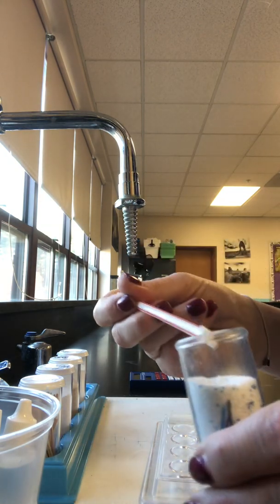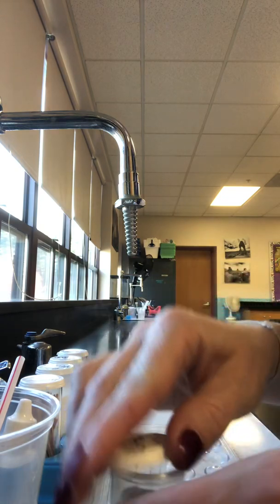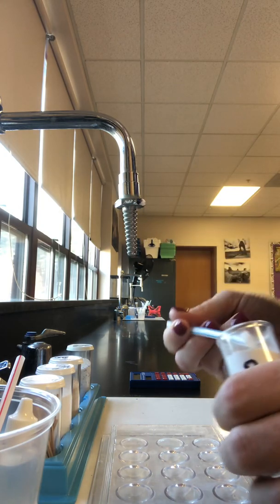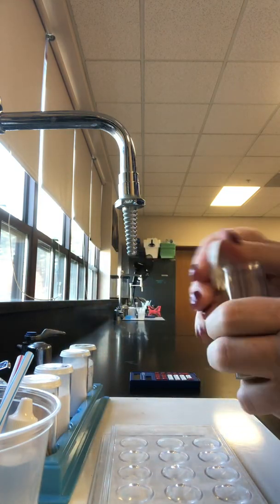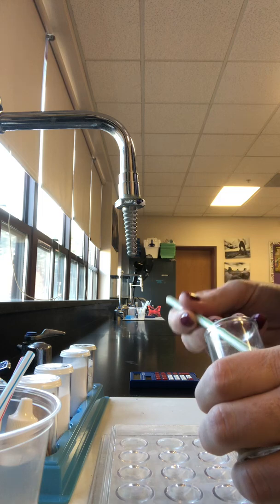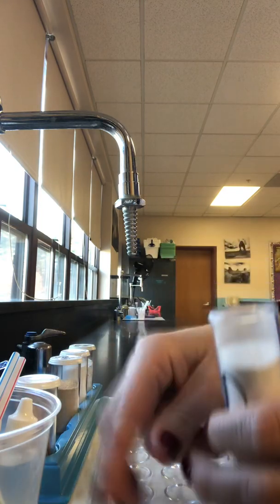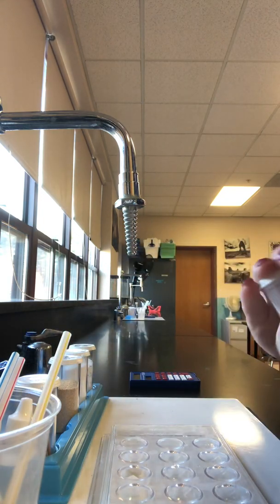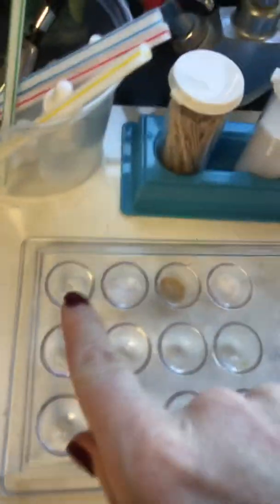I'm going to take a little scoop of the powder, and I'm going to drop it in spot 1. I'm going to put the lid on. B for blue in spot 2. Green is for 3, in spot 3. And yellow is for 4, in spot 4. Okay, so we have in spots 1, 2, 3, and 4, a sample of each powder.